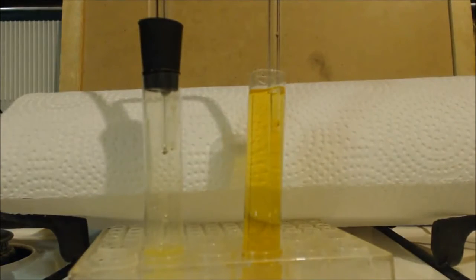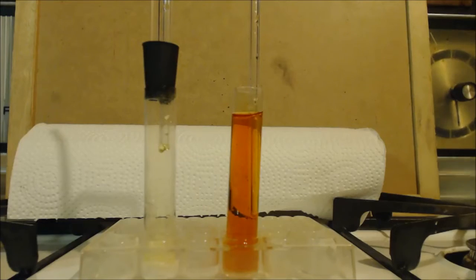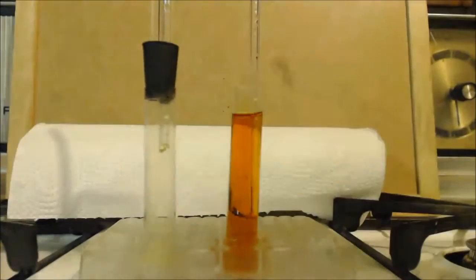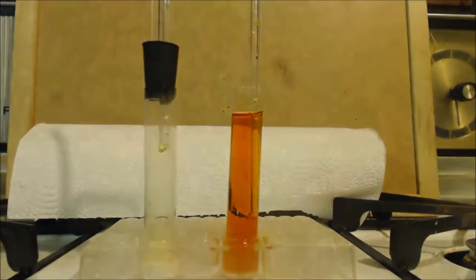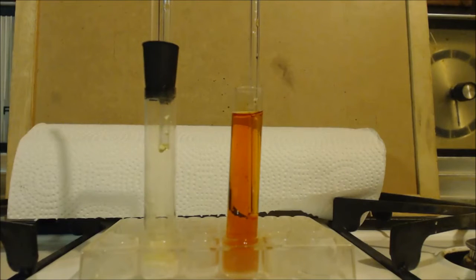I guess I didn't put enough hypochlorite in there. It's not producing any more chlorine. I'll put some more hypochlorite in there and some more acid, set it up. You can see it's a lot more red now. You're just replacing one halogen for the other, like when you do with metal. One's a more active halogen, one's a more active metal.